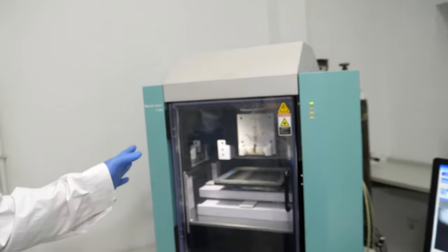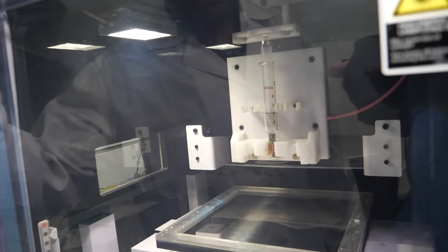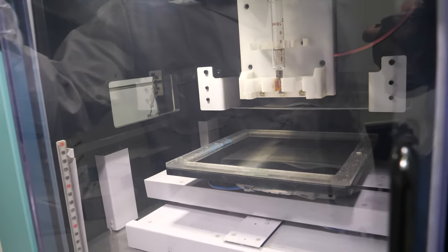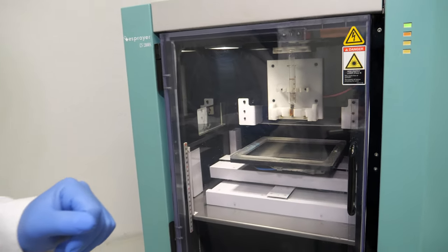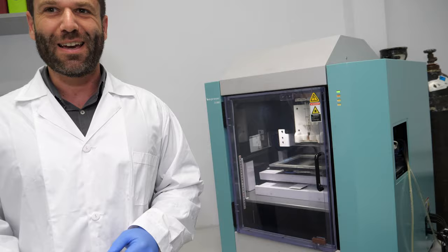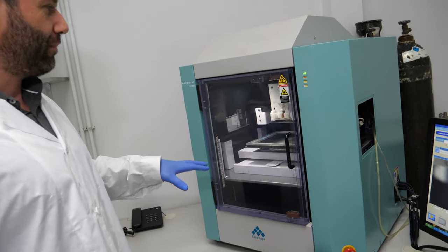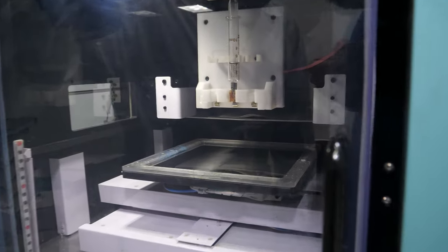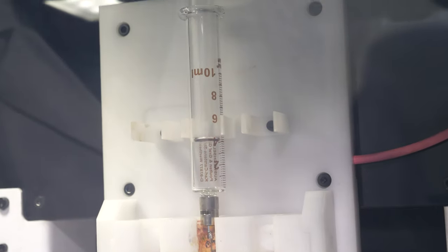Here you can see a device called electrospinning or electrospraying. As you can see, there is a needle. It's not a 3D printer, but it produces nano-level 3D structures depending on how you set the parameters. In that syringe over there, you put a polymer solution inside.